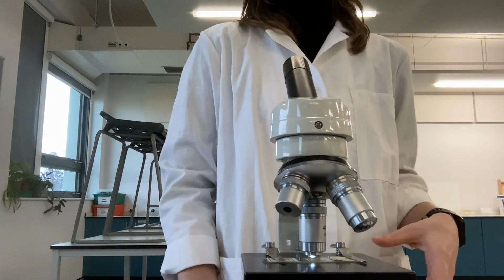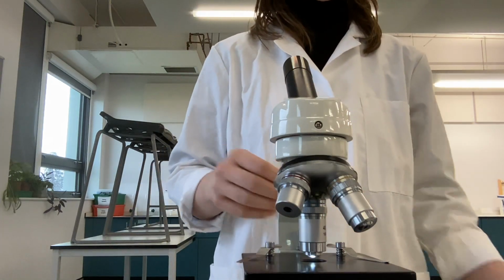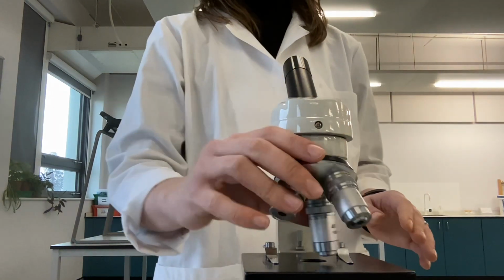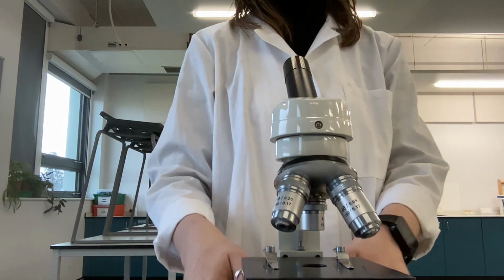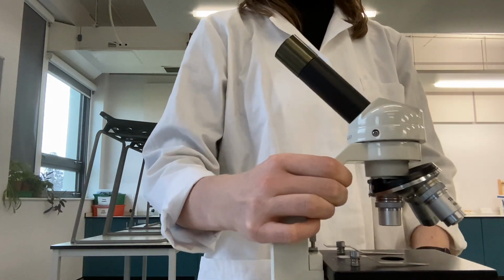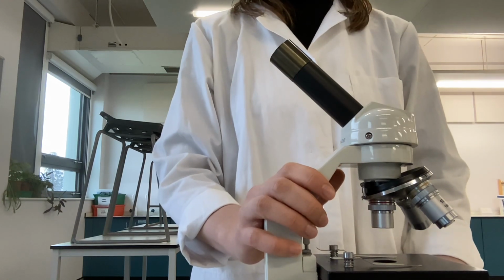When we have completely finished the PAG, where we no longer need the microscope, we need to make sure that the microscope slide is taken off the stage and returned to its box, the clips are turned in, and the light of the microscope is switched off. We then need to make sure that we have our microscope left on the ×4 magnification and that the stage is lowered as far as it can go. We should also make sure that the eyepiece lens is in a Z shape with the handle, as this makes it much easier to keep them tidy and safer when we are packing the microscopes away.